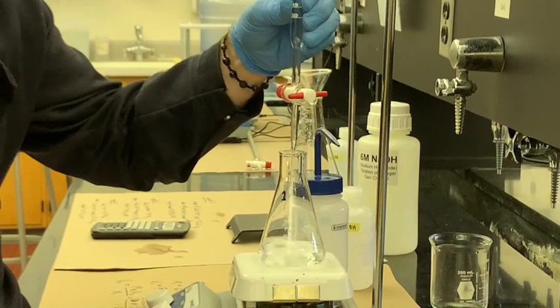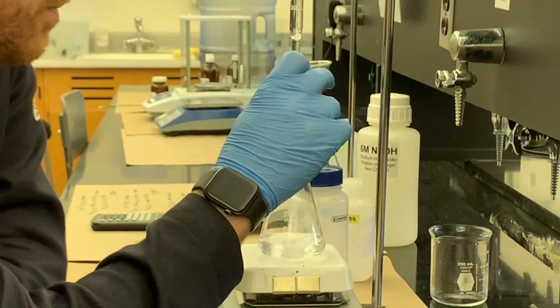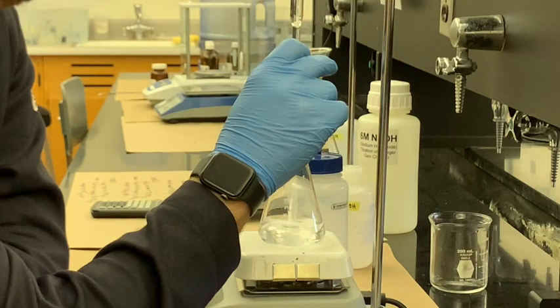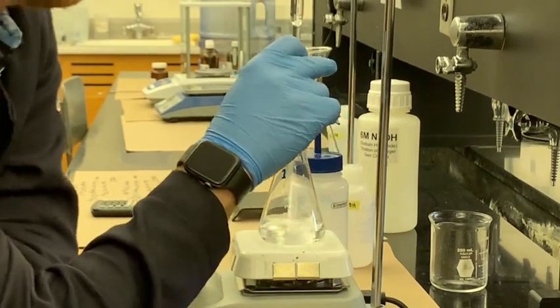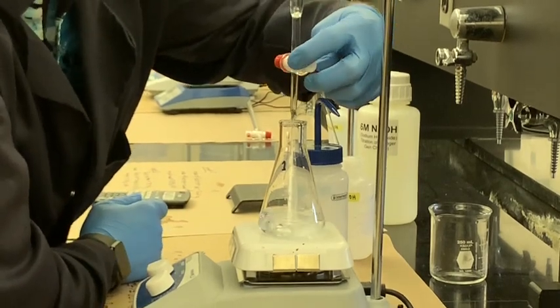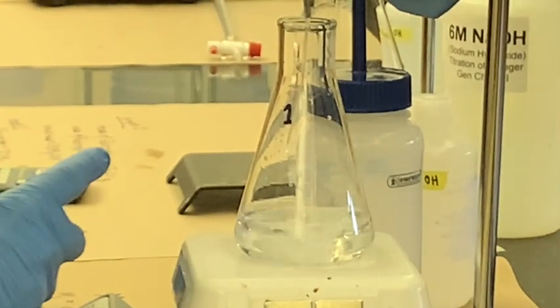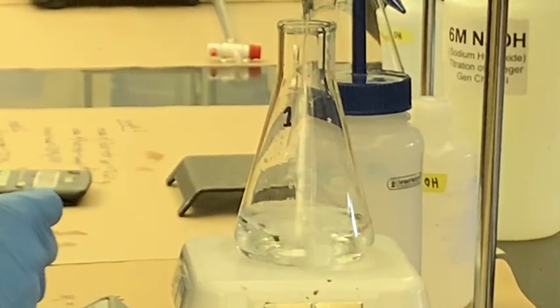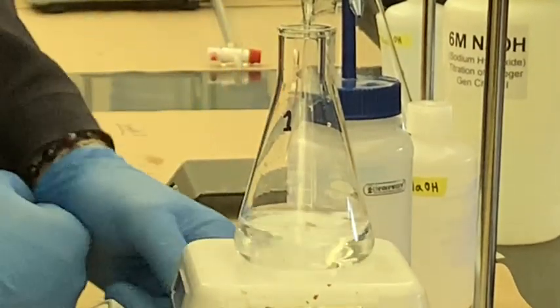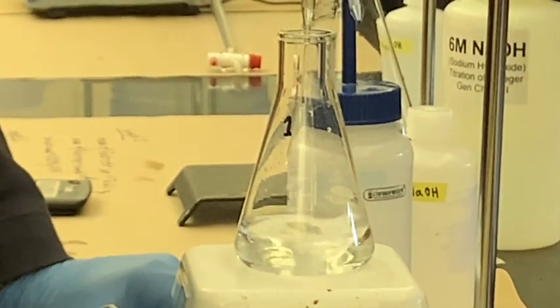So the first time you do your titration, you're going to want to go a little bit fast and just see where you end up. So let's see what's going to happen here. We got a little bit there. We'll just hold this right like this so you can see. I'm starting to see little flashes of pink when I drop the NaOH, and that's because the regions around where the NaOH is landing in the solution are a little bit more basic than other regions. Right now, we've used a little bit less than 7 milliliters.